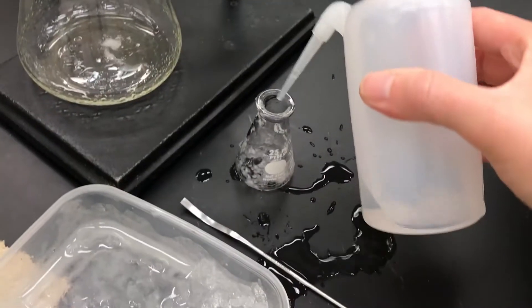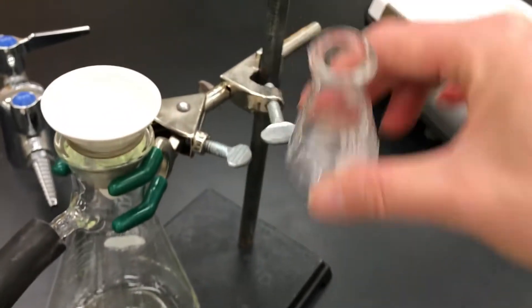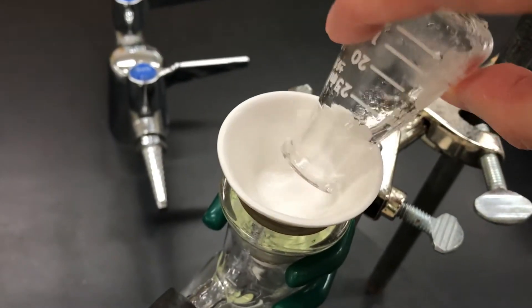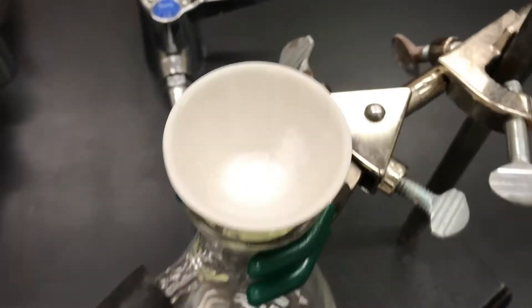In this case though, that solid was chunky, so it took several rinses to get it out. And small amounts of solids still on the flask are normal.